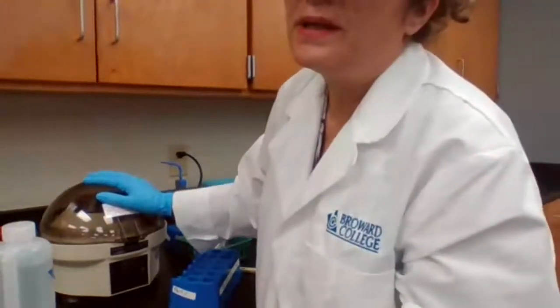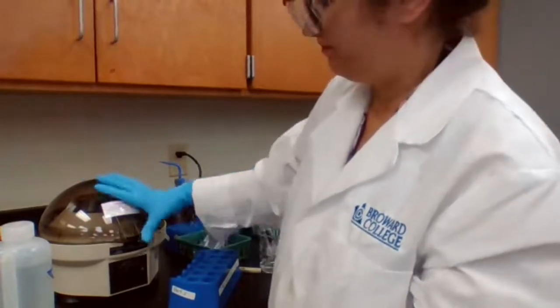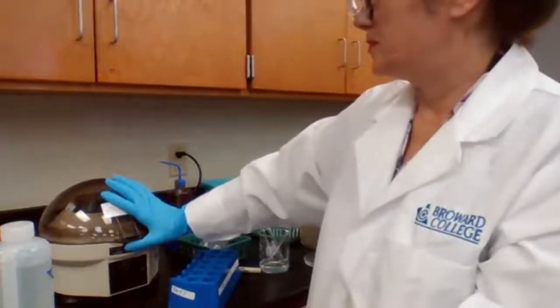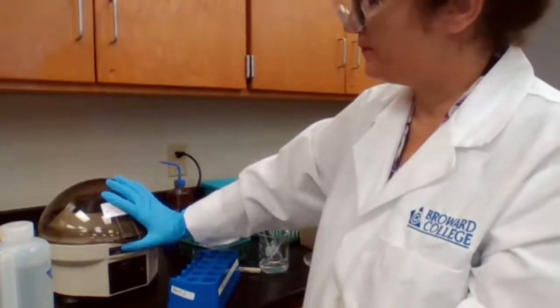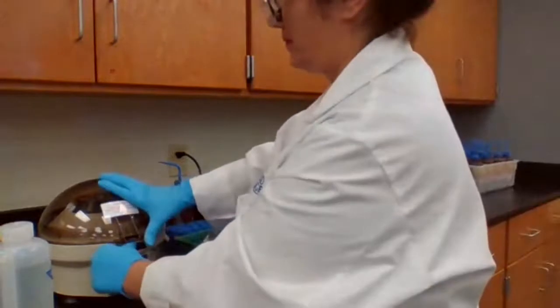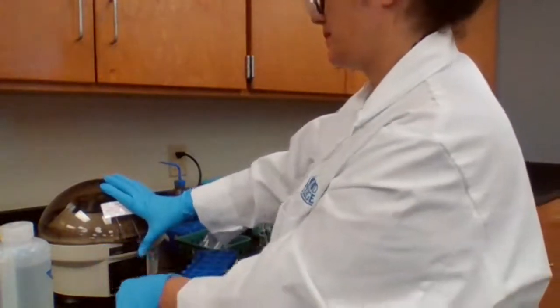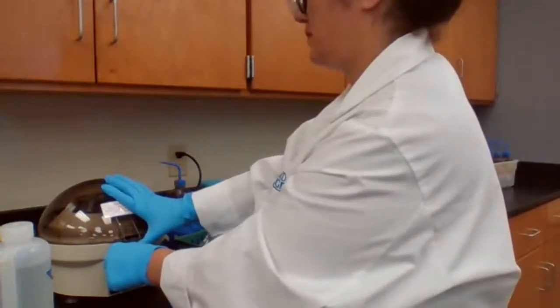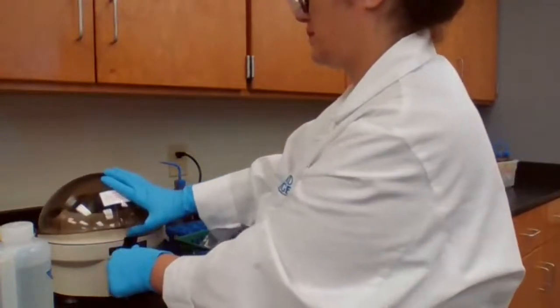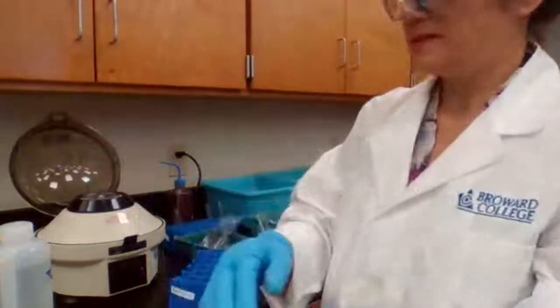Okay, we are still on step 1A2. So I had to repeat. Wait until it stops.